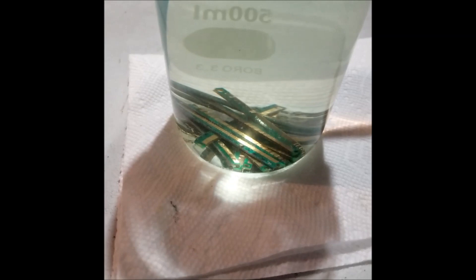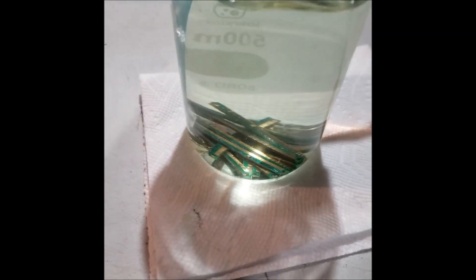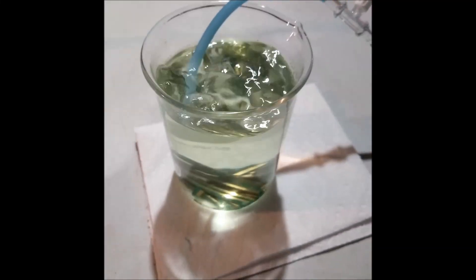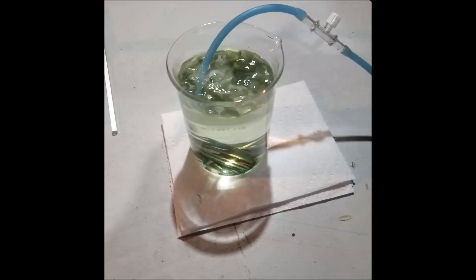The copper started to dissolve also on those RAM memory sticks, so I've cut the gold strips off and had to restart, but no problem.